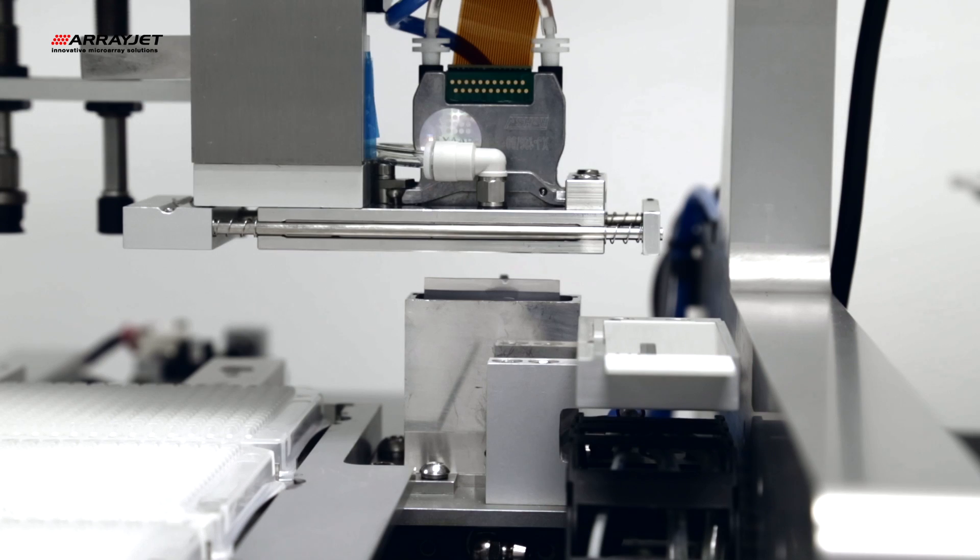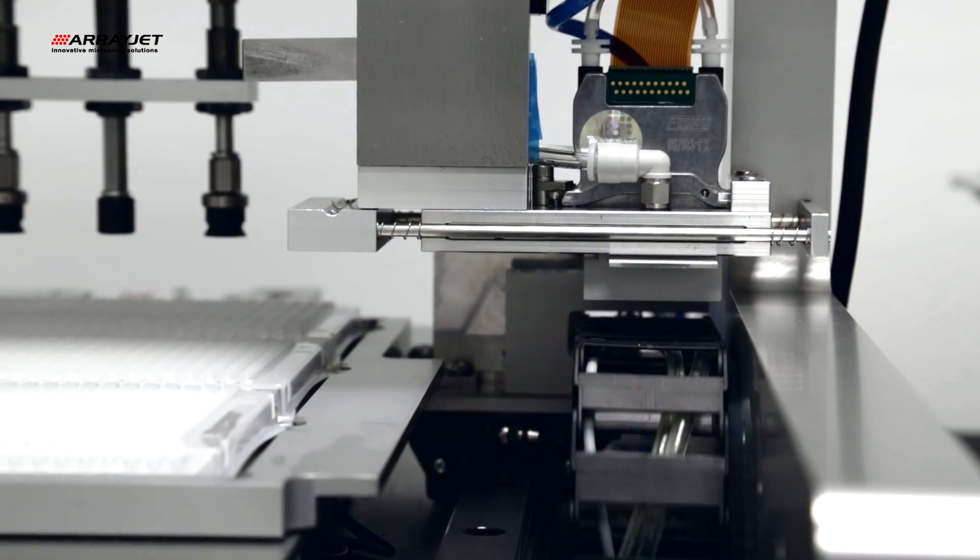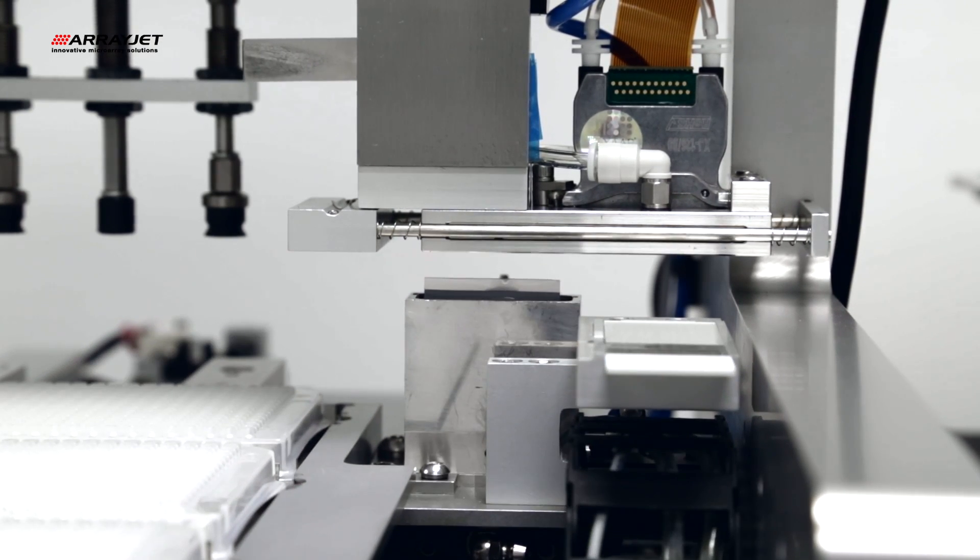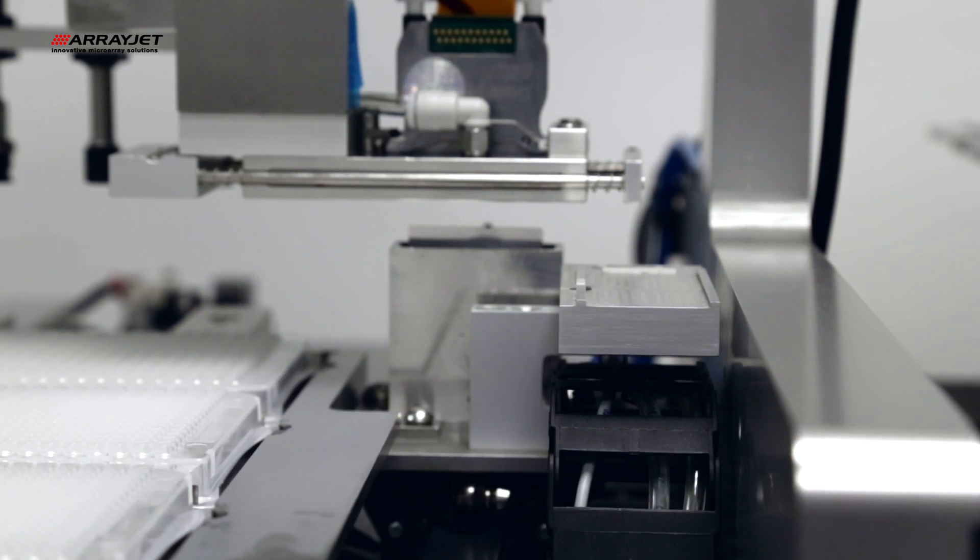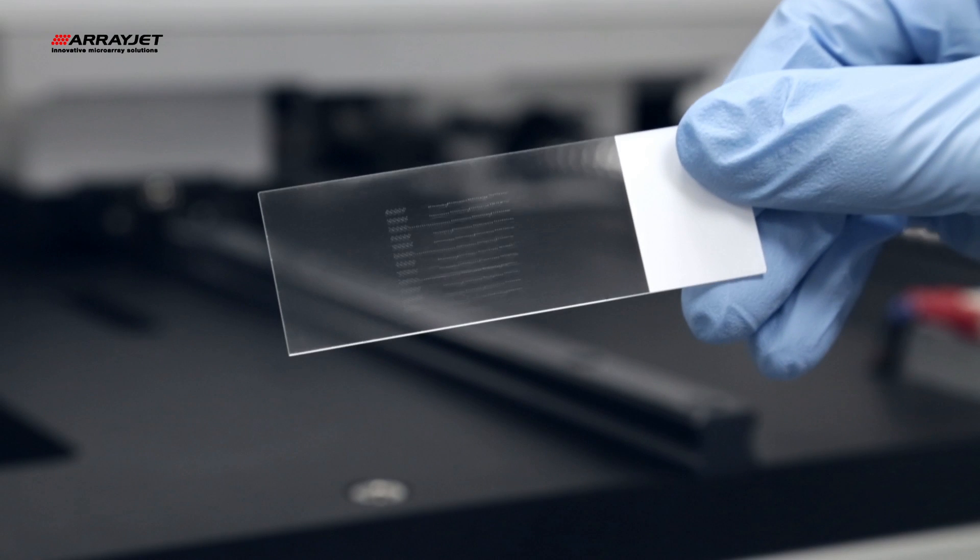Here, a test slide is loaded by a microarray user who runs a test protocol using system buffer in just a few seconds. A visual inspection confirms that each printing nozzle is fully functional.